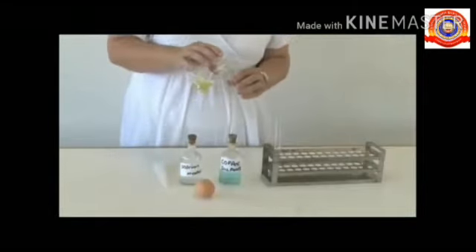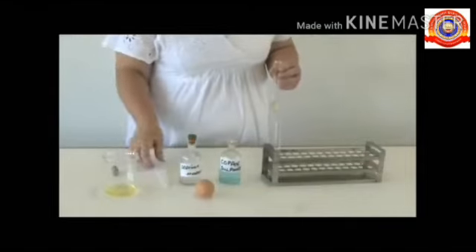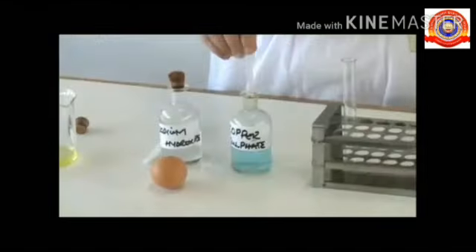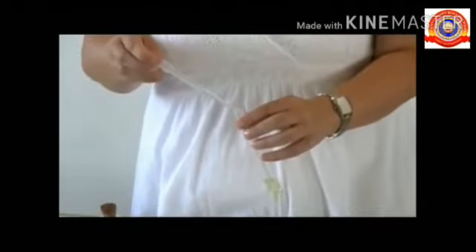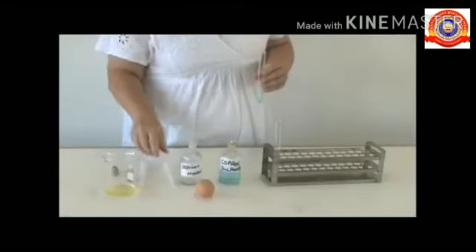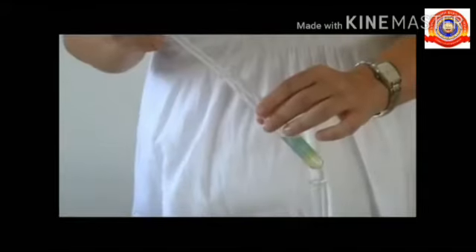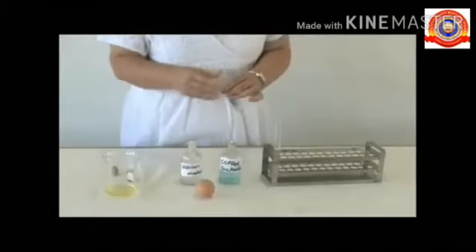Add water to egg white and stir it well. Take it up to a quarter of a test tube. Add two drops of concentrated copper sulfate solution to it, then stir it well. Then add eight to ten drops of concentrated sodium hydroxide to it. The appearance of violet color indicates the presence of protein.